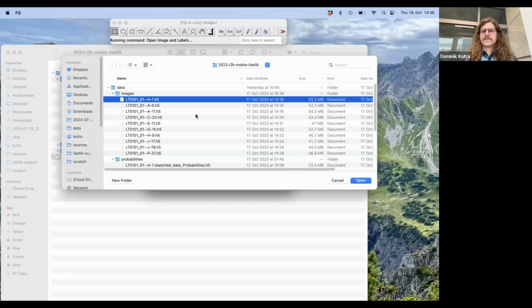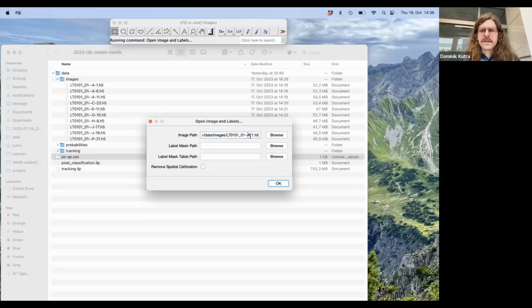This I will do exactly as before. I click on the first image, and I exchange my part that is varying with the dot star. Then the label mask. This is an image where each object is identified uniquely by assigning it a unique value.